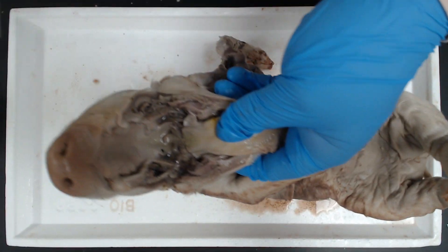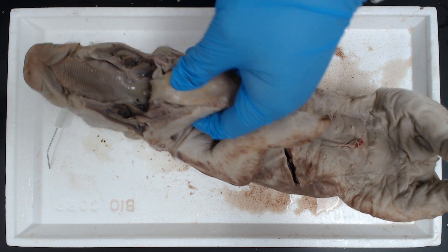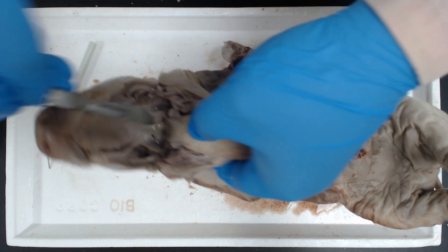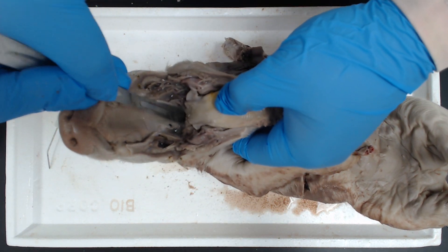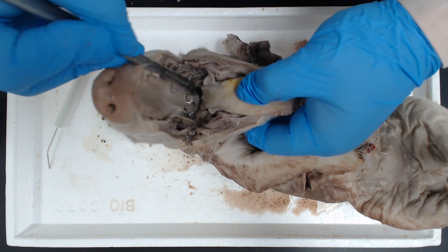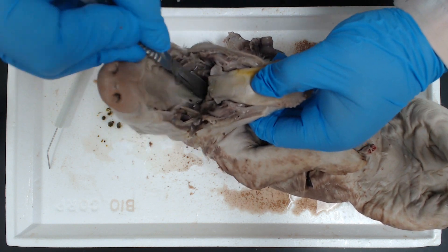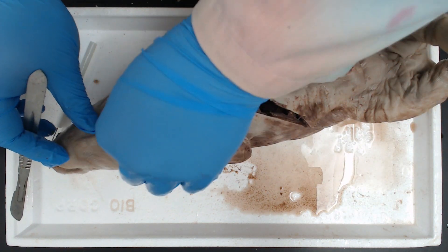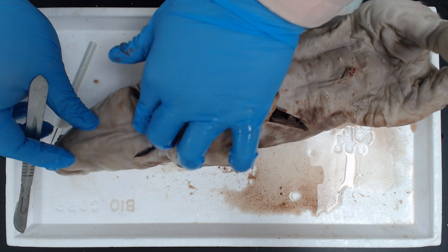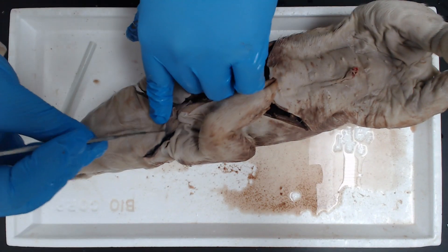It's going to help separate out food and air. We want to remove that along with the rest of the larynx, but we don't want to damage too many things, so we're going to try to leave the jaw intact. Cut around the epiglottis — I'm going to go on the underside here. You can feel a ball inside of the throat, and we're going to make cuts on either side of that ball.